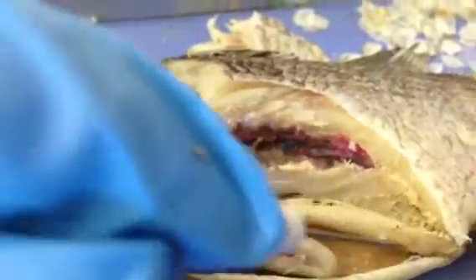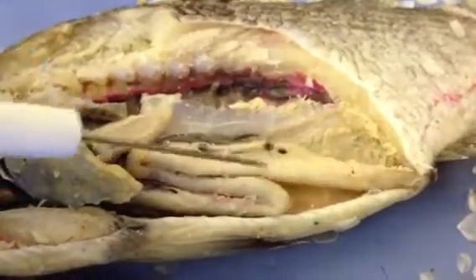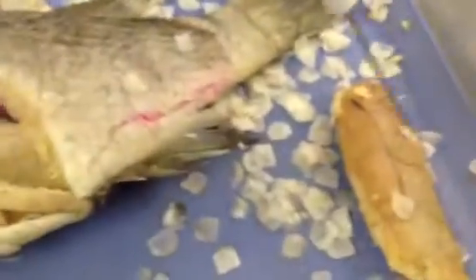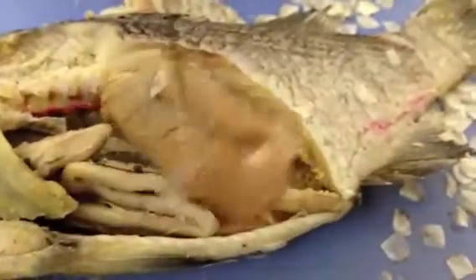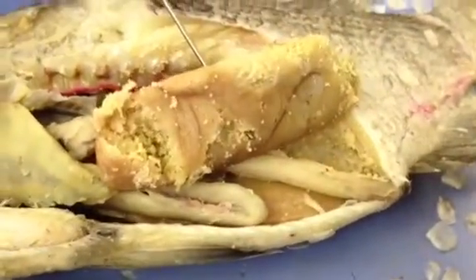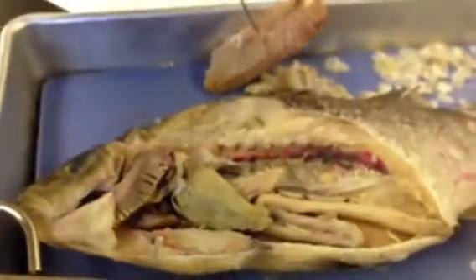And you normally see the caudal artery, which ends right here. Remember, it runs along the small intestine. And the female has 1 artery that runs to the ovaries, and the male has 2 pairs of arteries, left and right, dorsal gonadal arteries. And this is one of the ovaries, and you can see that the eggs are inside of it. Okay. So this is it.